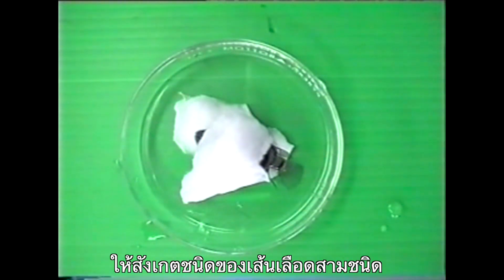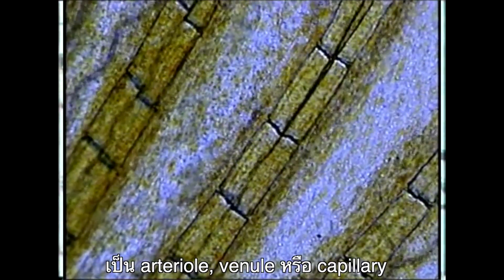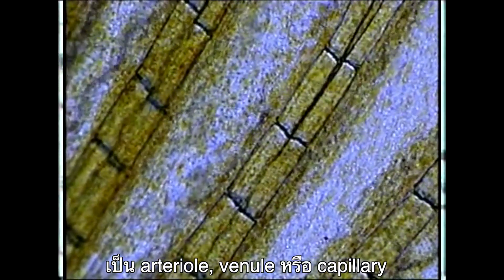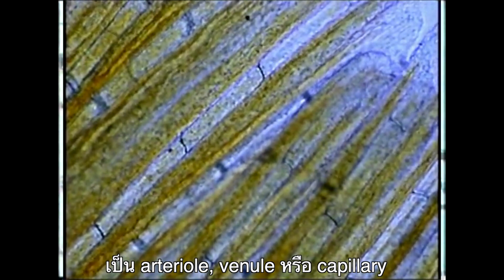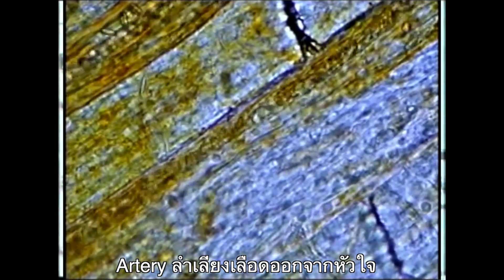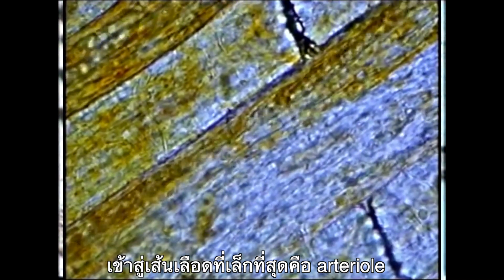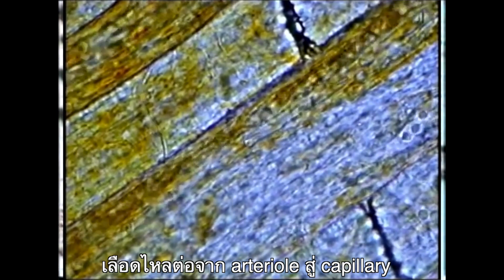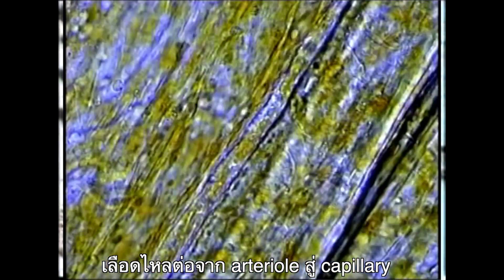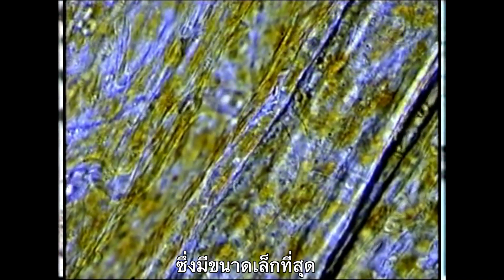In this lab, we will focus on three different types of blood vessels: arterioles, venules, and capillaries. Arteries transport blood away from the heart and branch into smaller vessels called arterioles. Next, blood flows from the arterioles into capillaries, which are the smallest vessels.